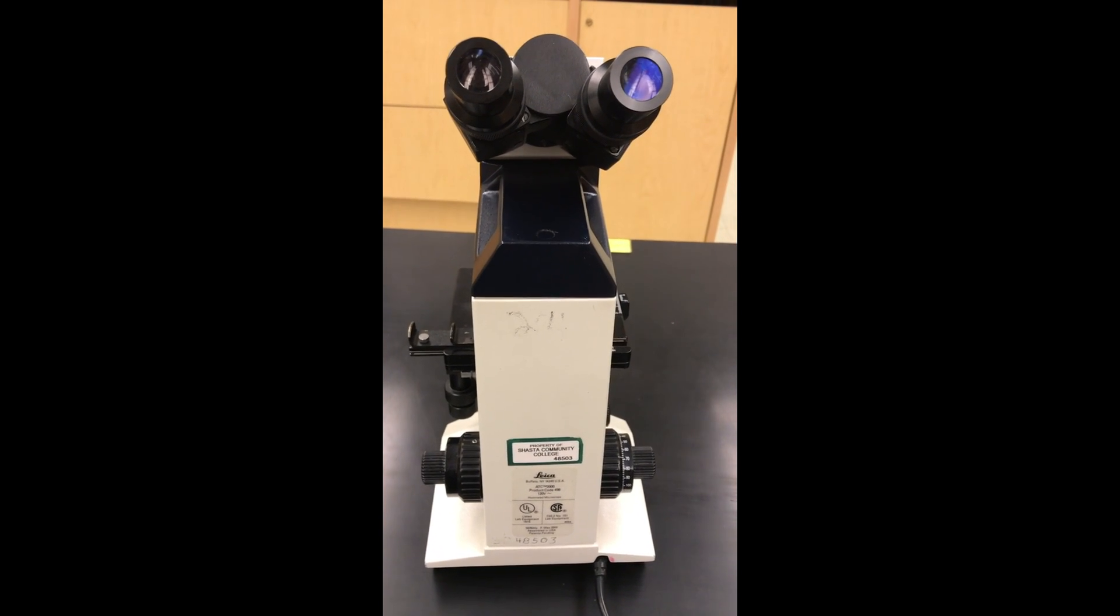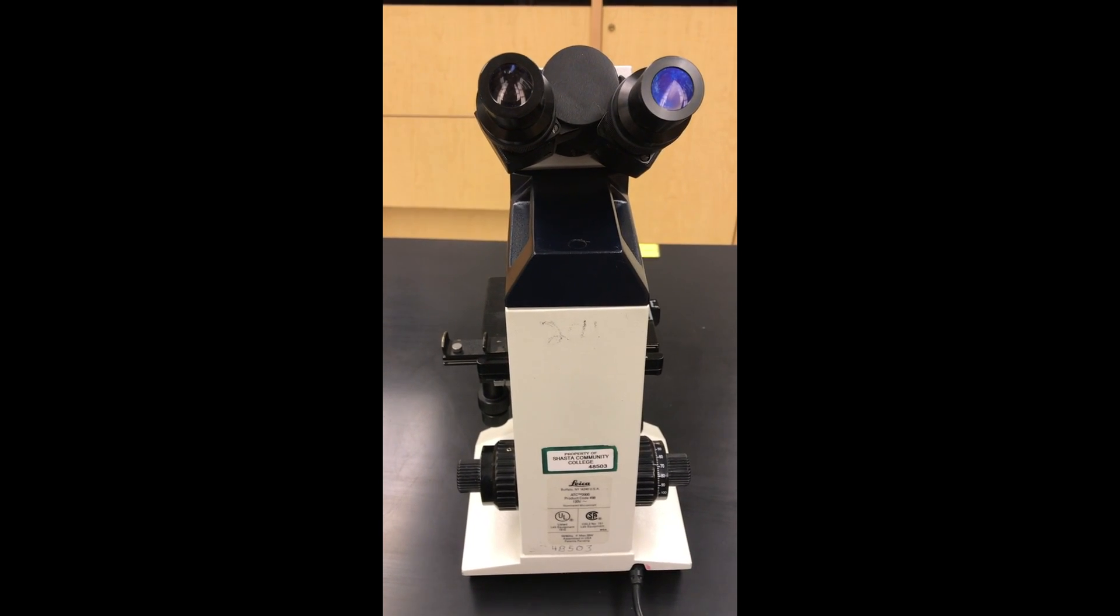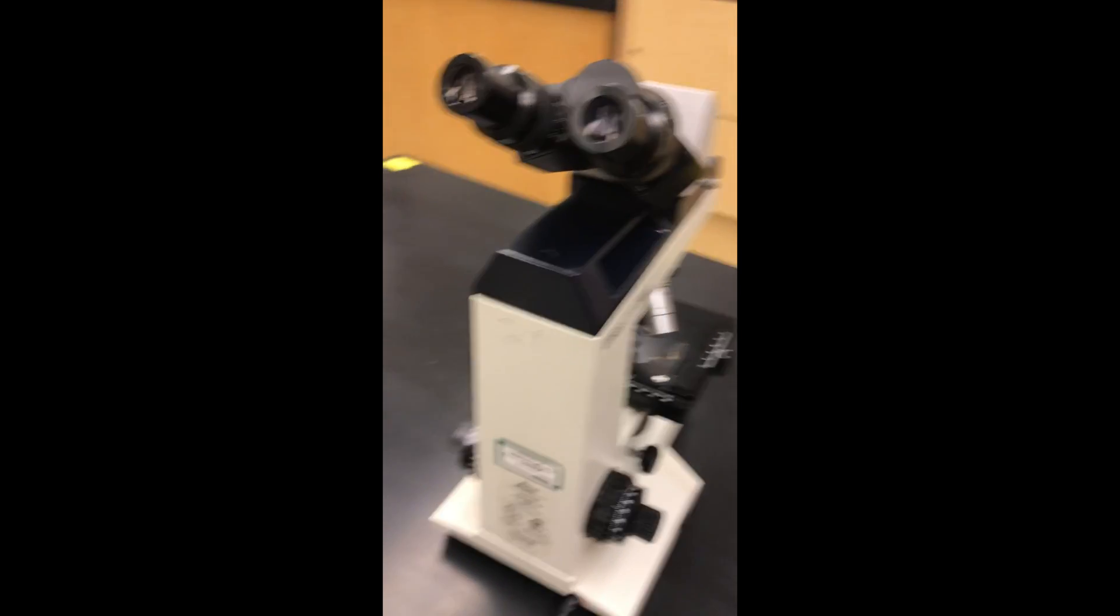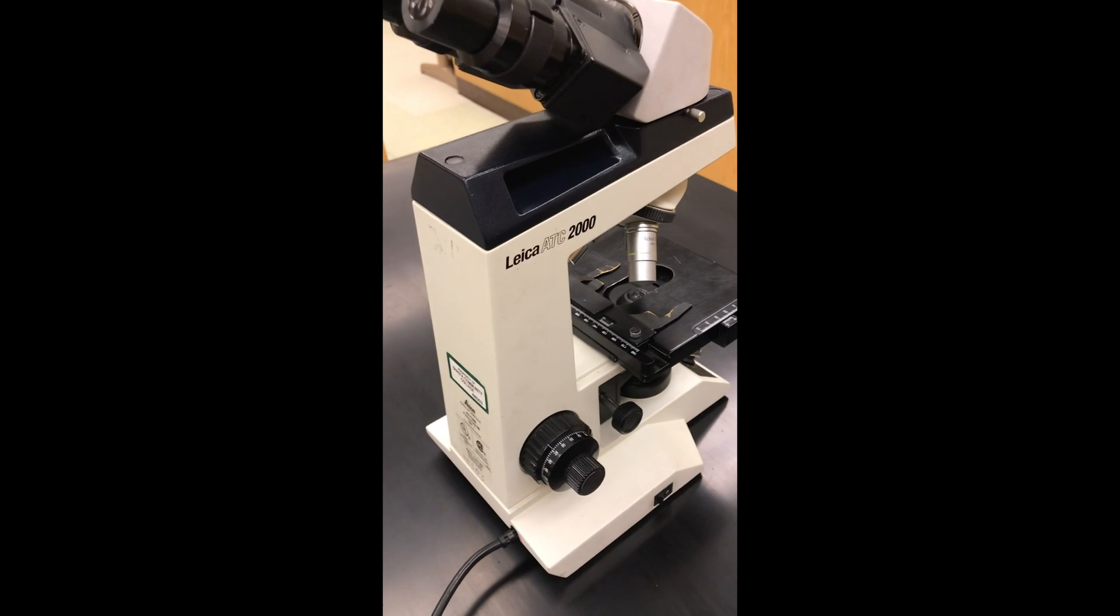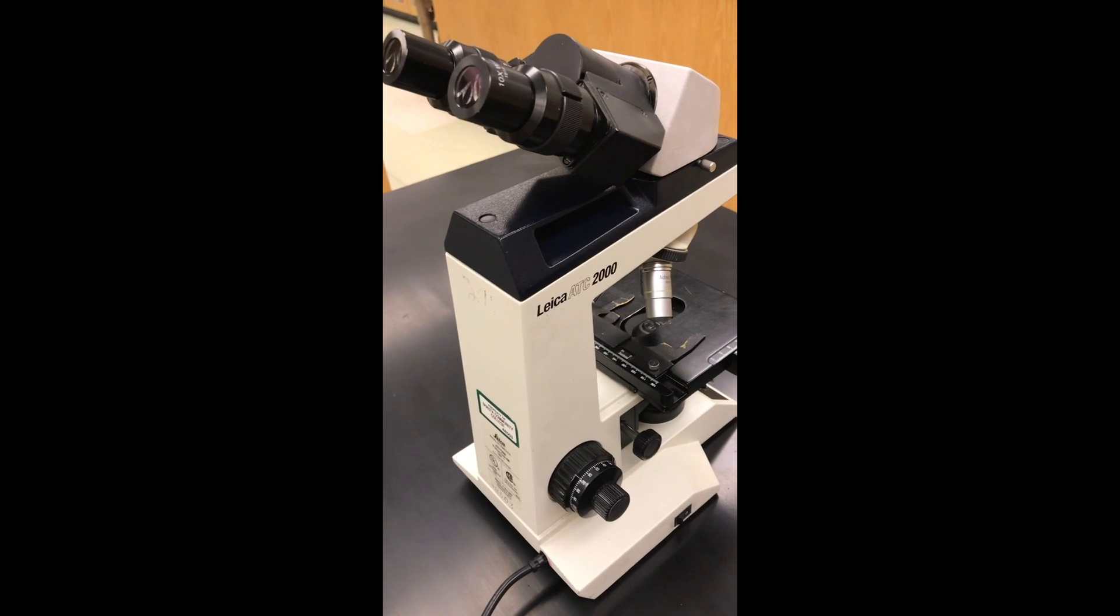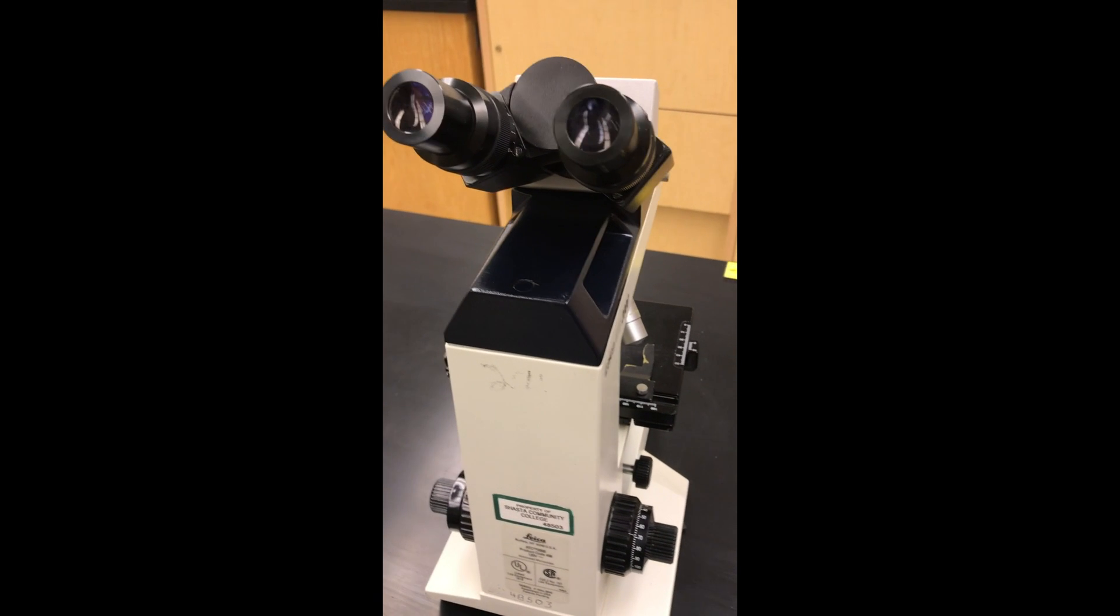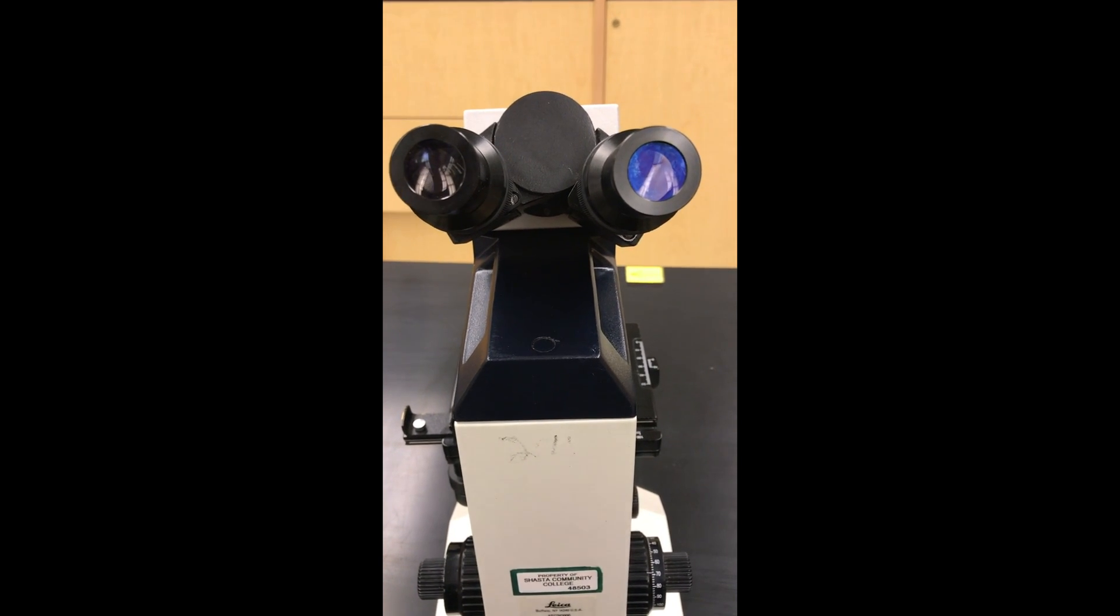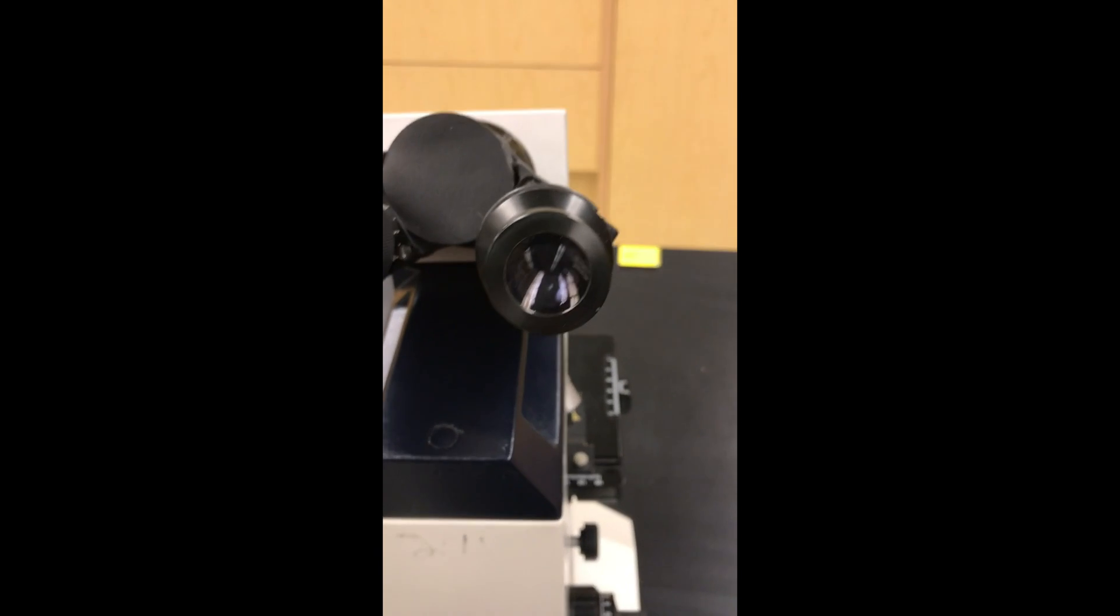Good afternoon everyone. This video is basically an introduction to the microscope. This is our microscope that we have here in the lab. Many of you are probably familiar with microscopes, so this is probably going to be boring, but for those of you that have not used them before, this will be really helpful. I'm going to go through parts as well as how the microscope works.